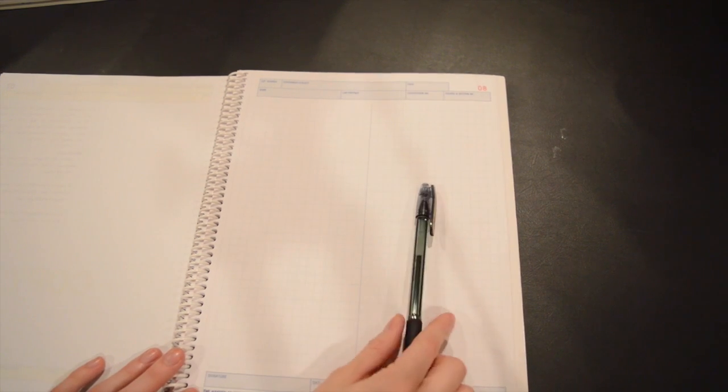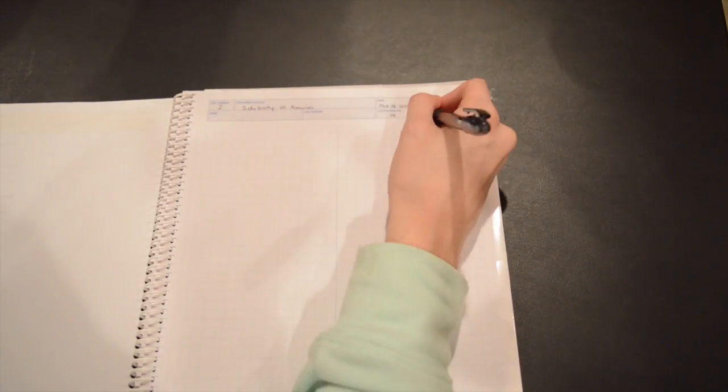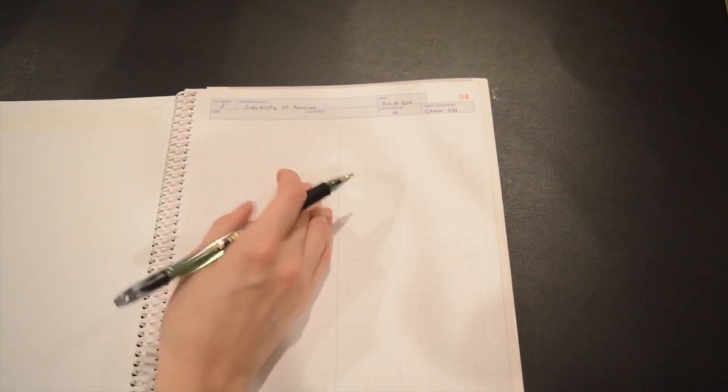The left side of your notebook is going to be used for rough work and observations during the experiment, while the right side is where the good copy of your report is going to go. We'll begin by filling in the top section. The left side of the page is used for the work that you do during the lab, so you can record anything that you need to on this side.